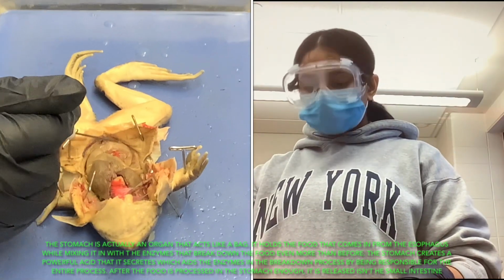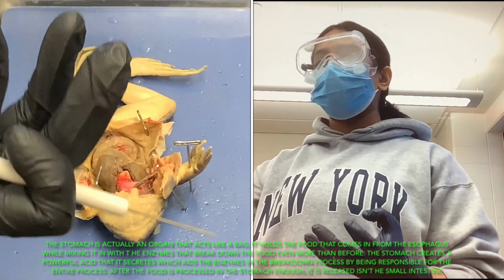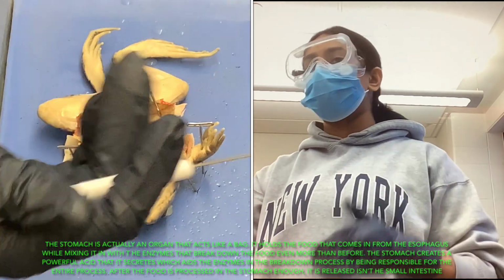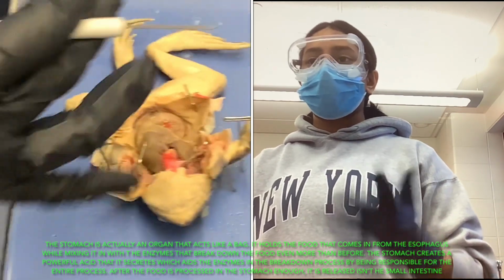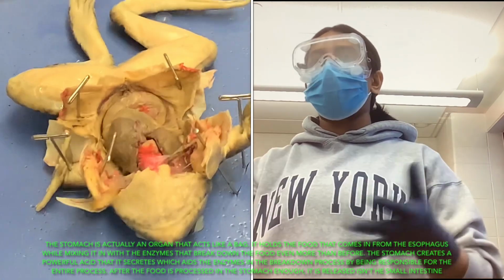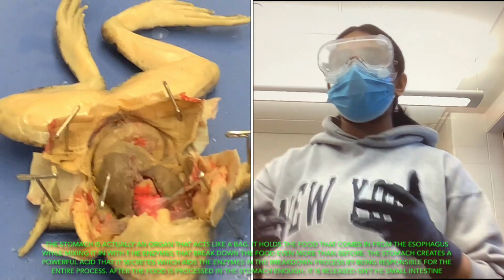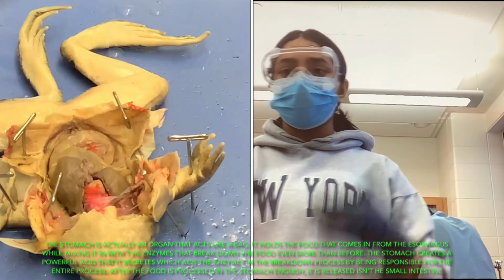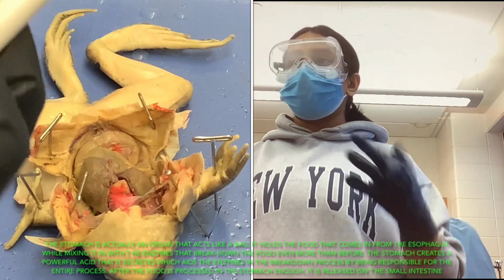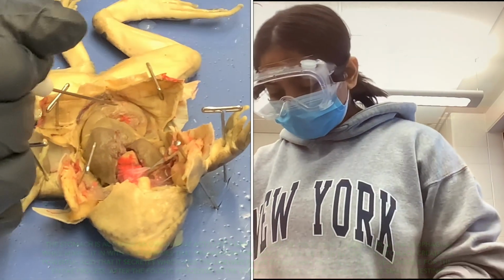So the stomach is an organ that acts like a bag. It holds the food that comes in from the esophagus while mixing it in with the enzymes, and it breaks down the food even more than before. The stomach creates a really powerful acid that aids the enzymes in the breakdown process, and it is responsible for the entire breakdown process. After the food is processed in the stomach enough, it is released into the intestine.